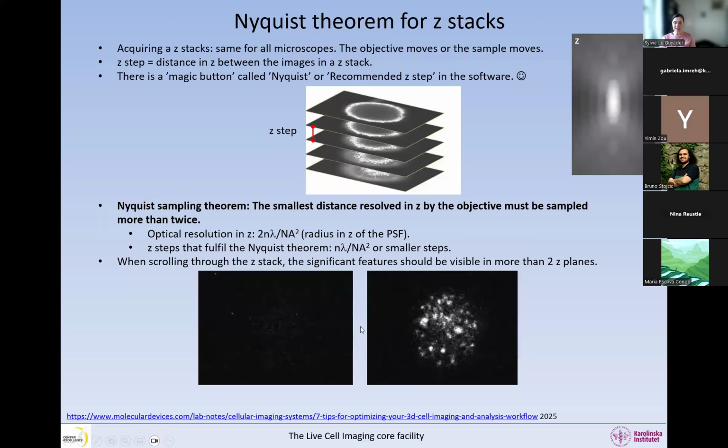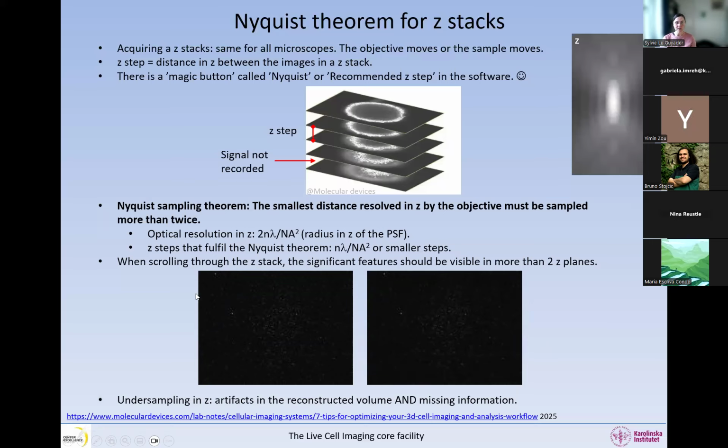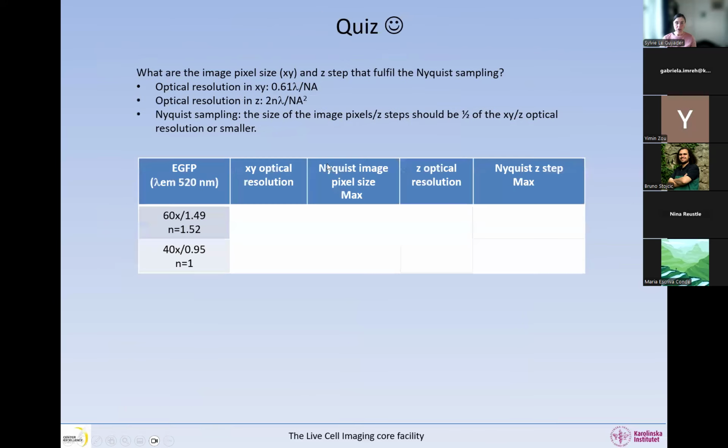Now, if I instead use very big steps, I do not measure between the Z steps, right? If you check one spot, each of them is only represented in 1 image in the Z stack. That is undersampling these spots. Not only will you create artifacts, but you may also miss some spots, okay? This is the way you check with your scientific question whether you're sampling enough or not. The signal between the Z planes is not recorded. When you undersample in Z, you also create artifacts in the reconstructed volume, and you're missing information because the signal is not recorded in between. So this was in Z.